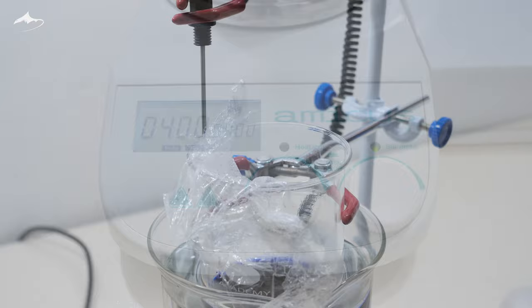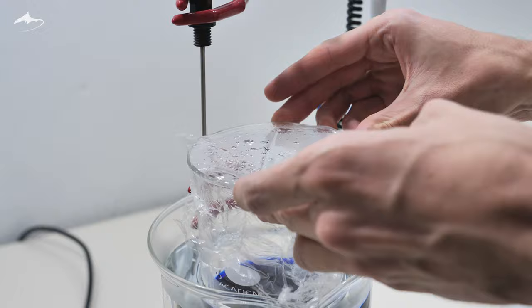Eventually, all of the salt was dissolved so the heat to the water bath was turned off and some insulation layers were arranged. Firstly, the beaker was made airtight with plastic wrap and an elastic rubber band.